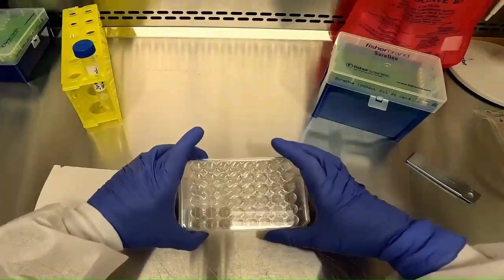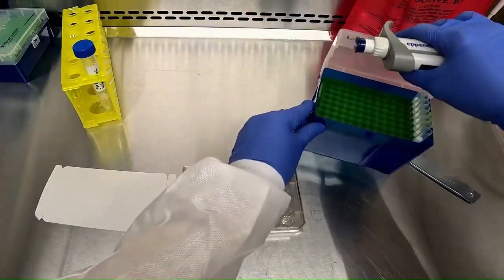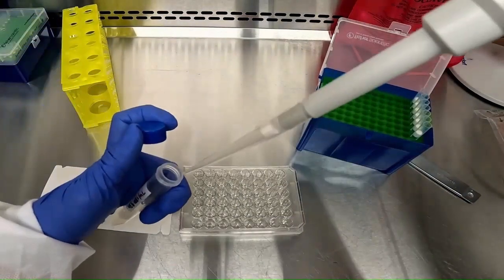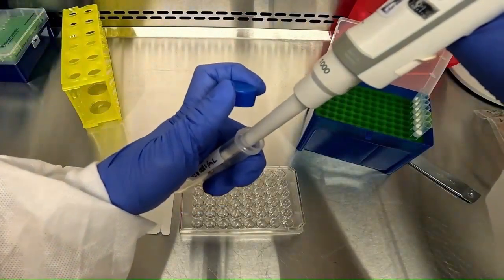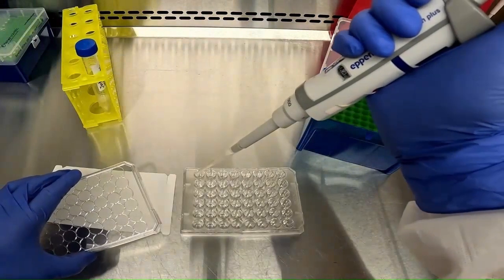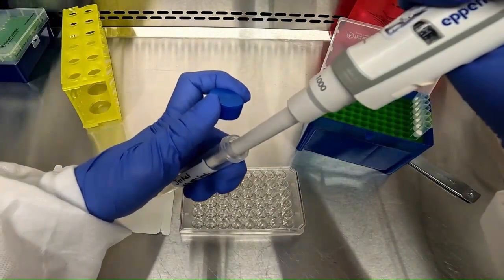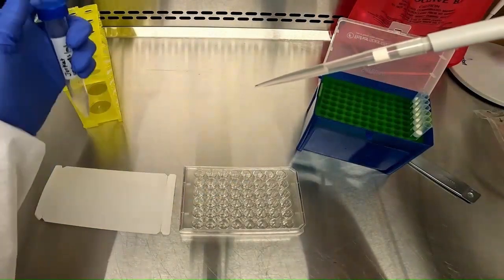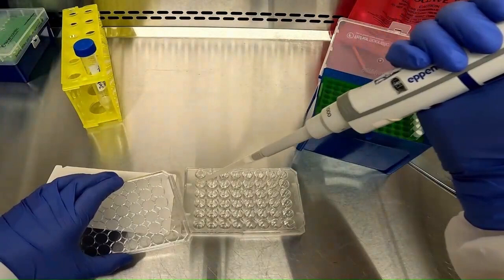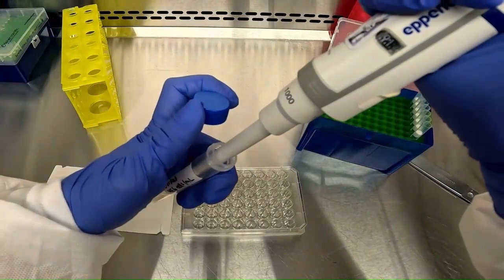Loading cells and reagents into the wells of BioFlux plates follows the same procedure as with a regular plate in a static assay. However, it is crucial to avoid bubbles to prevent introducing air pockets in the microfluidic channels. To do this, we just pipette our cell suspension very slowly into the wells. So we're going to load various wells on the plate. And while we're loading cells, it is always important to remember to follow proper sterile technique to prevent compromising the health of the cells for the experiment.